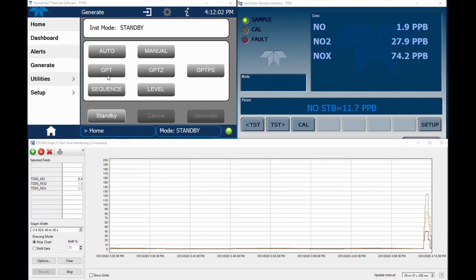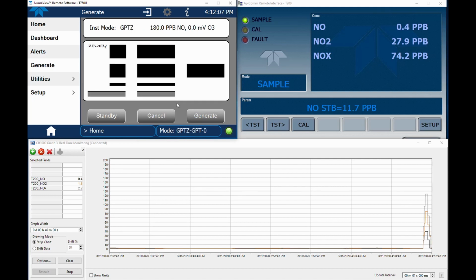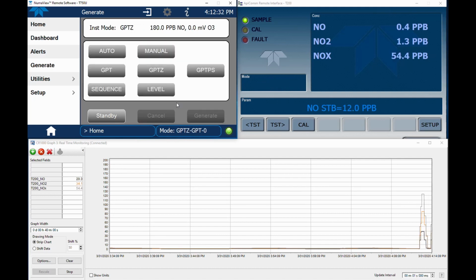Alright, we've completed the reaction chamber cleaning on our 200 series NOx analyzer. Hopefully, you can see that this is a relatively easy process that can greatly improve the quality of your NOx data. This post-maintenance GPT-0 and GPT shows an improvement in response compared to the one shared at the beginning of the video. Following maintenance, our analyzer reaches calibration targets much quicker, and it lines out much faster and in a more repeatable manner. This data was collected approximately 12 hours after the instrument was turned back on, but the calibration was performed within a few hours of turning the instrument back on.